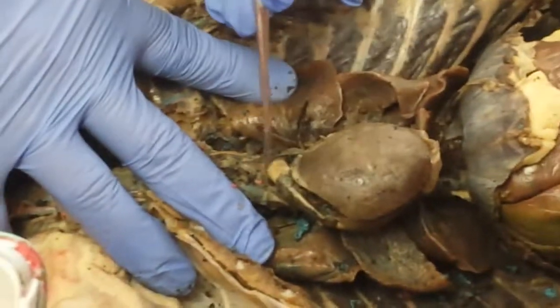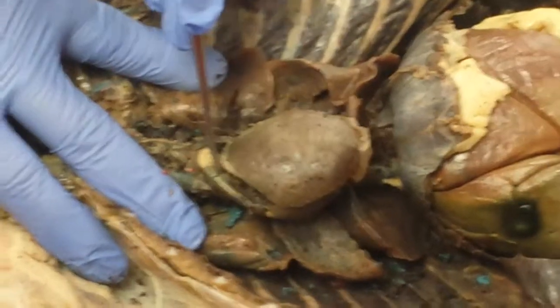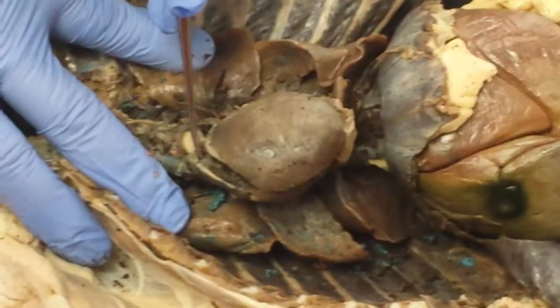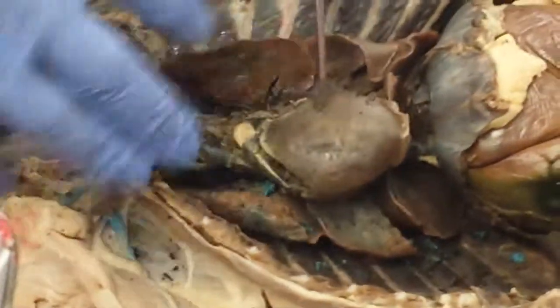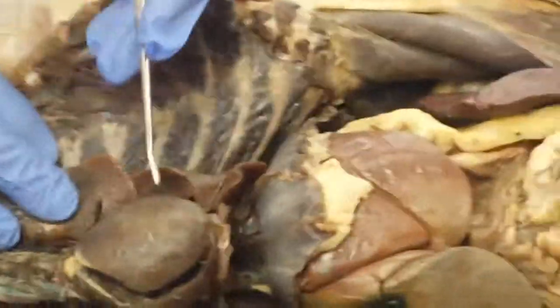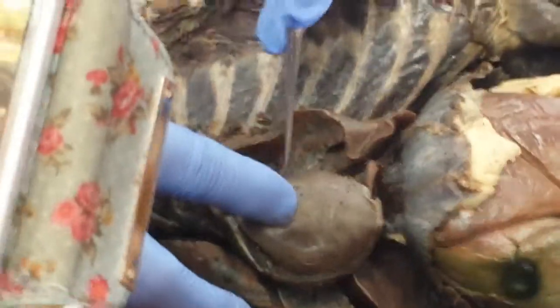What is this little tag here called? The auricle. Remember the dog ear? So that's called the auricle of the atrium. Similarly, on the left side, this dog ear here, auricle. What's the purpose of the auricle? Increase blood volume. Increased volume. That's all it does. So now we have identified right ventricle, left ventricle, right atrium, left atrium, and the auricles. We've identified the apex and the base.